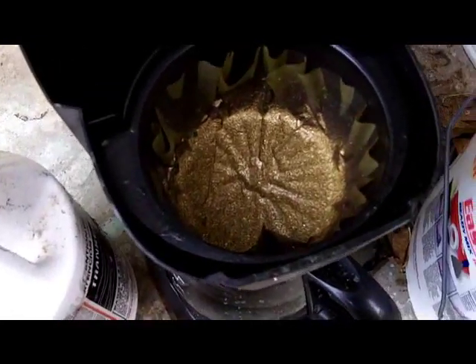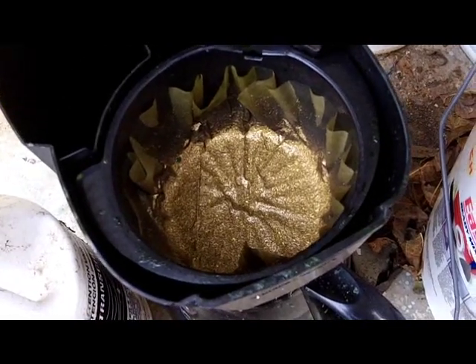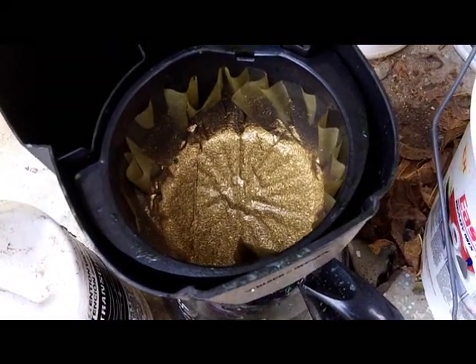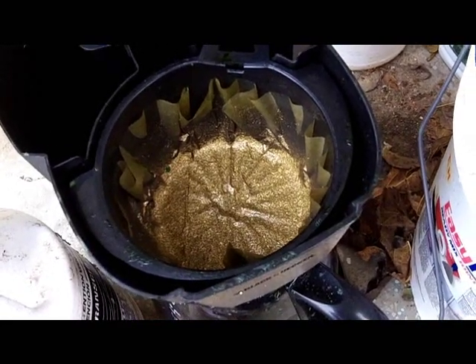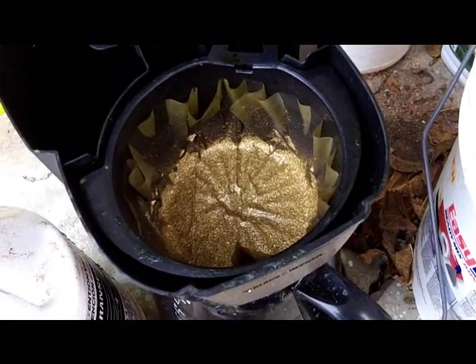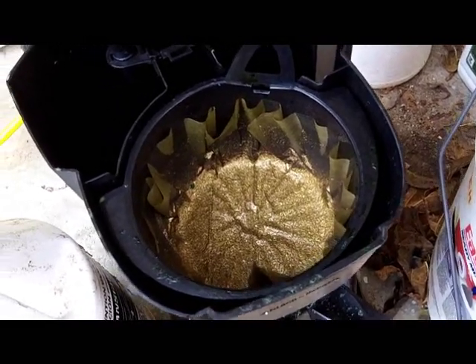Just in the process of filtering off this stuff, the first time I did collect quite a bit of gold. It needs to be washed with HCl — hot boiling HCl actually — to get a little bit more of the copper out of it before I start digesting the gold. But we'll get there.